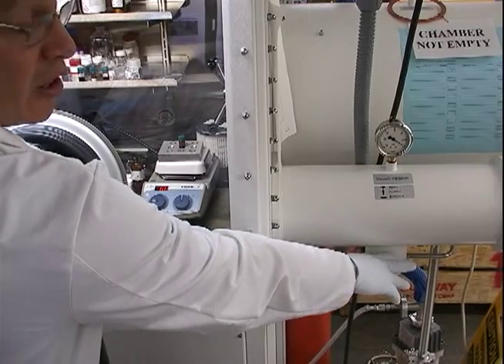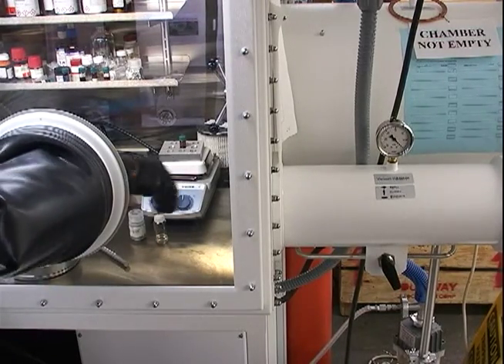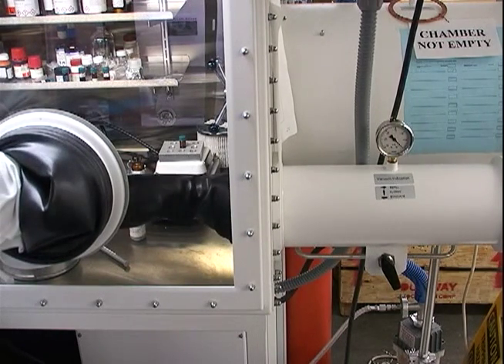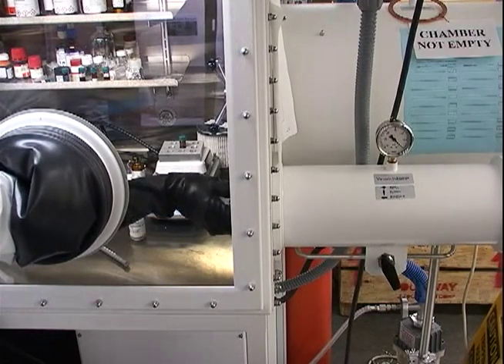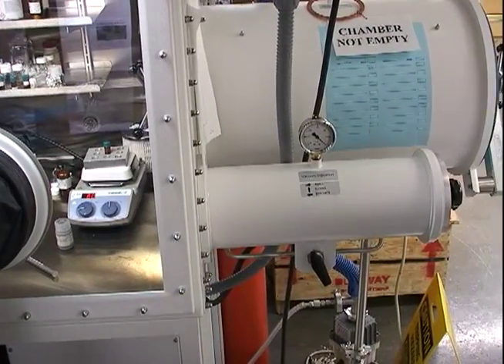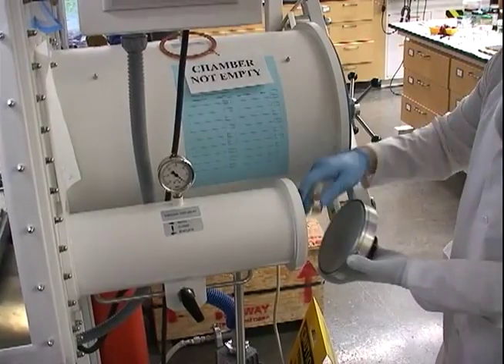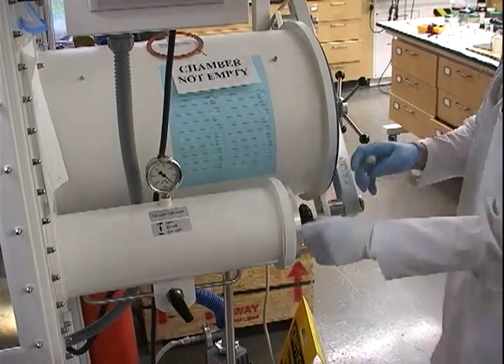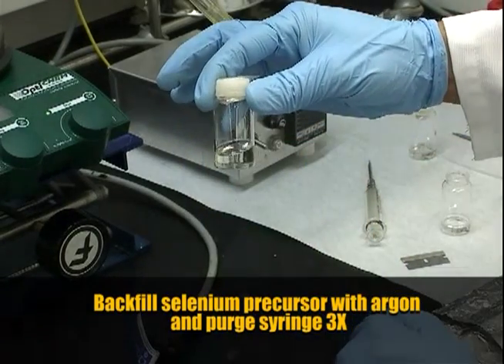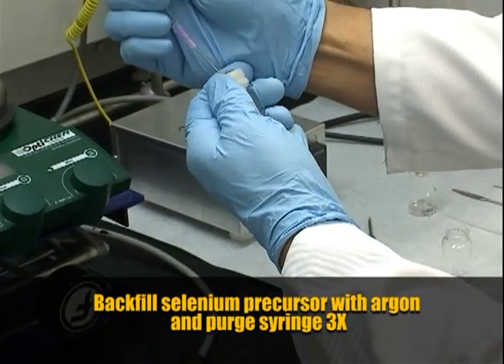As our cadmium precursor solution increases to injection temperature, we are going to transfer our selenium precursor solution over to our hood. We refill our antechamber with argon so we can transfer our vial over. As we prepare to inject our selenium precursor solution from the glove box, we first have to backfill with argon to ensure that we don't expose it to air. Using a positive argon line, we start supplying inert gas.